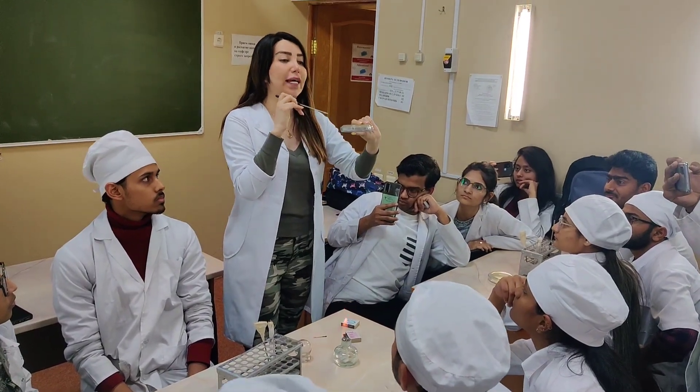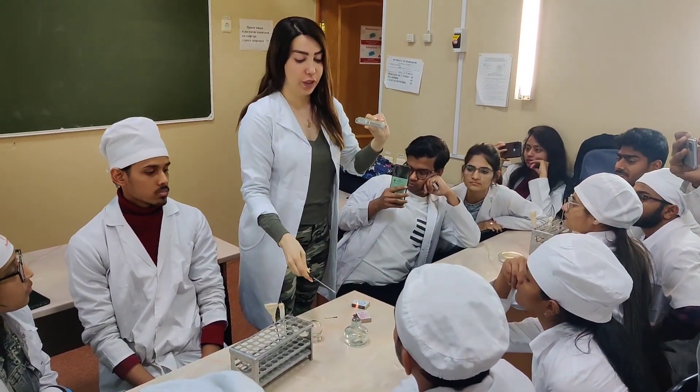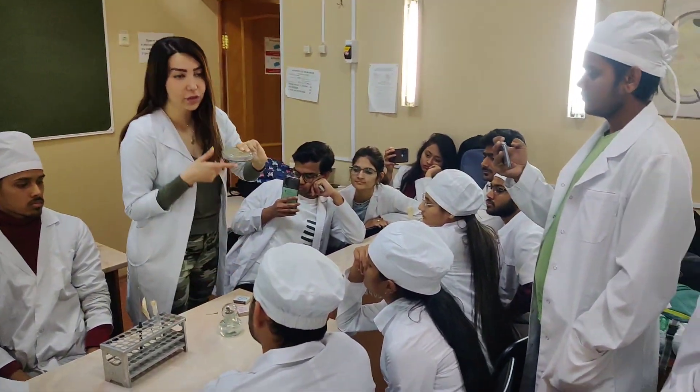After that, try a little bit — so, gently make a circle. After that, you will try this again. And done.